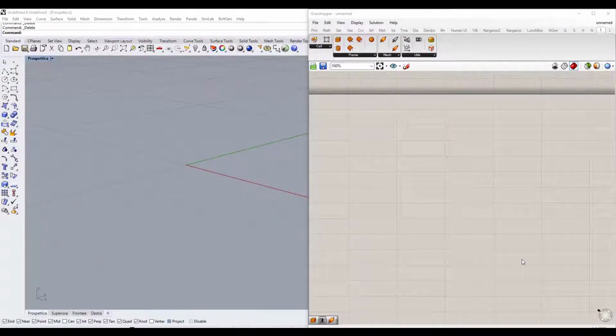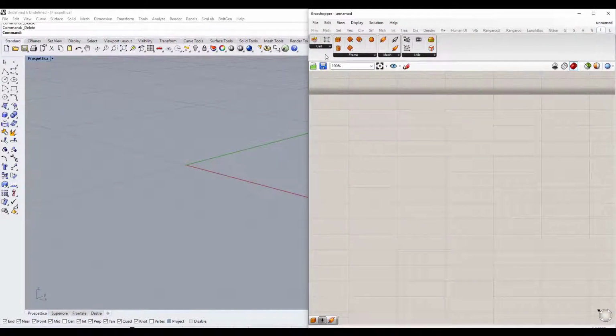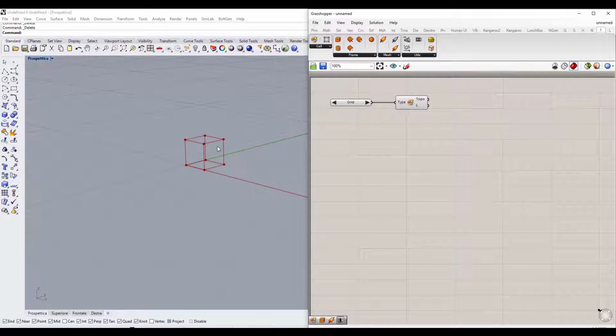Okay, now we are in the Rhinoceros and Grasshopper main windows. We click on the IntraLattice component. Now let's choose the elementary cells that will compose our scaffold. To do this, we click on Preset Cell and drag it to the Grasshopper main window. In the 3D window of Rhinoceros, you can see the elementary cell that we have selected in Grasshopper.